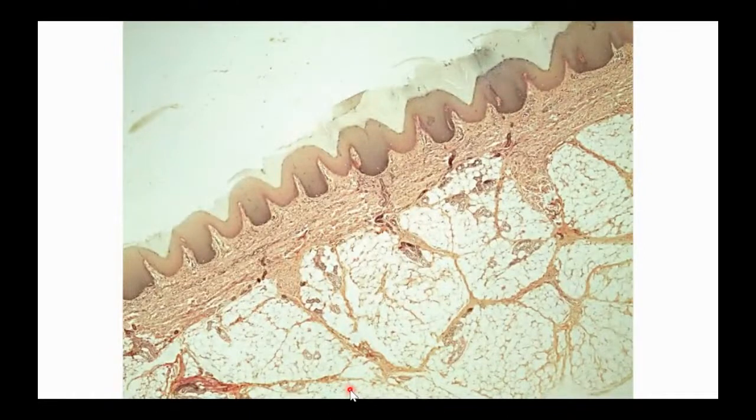The hypodermis, the place underneath your skin, is where we find adipose tissue. And this is actually the place in the body where you find the most adipose tissue, ironically. So adipose loose connective tissue, you can actually find that in many, many different places in the body. So if you're looking at a slide and it looks like there's adipose tissue on that slide, in addition to what you're looking at, you're probably right. There probably is.